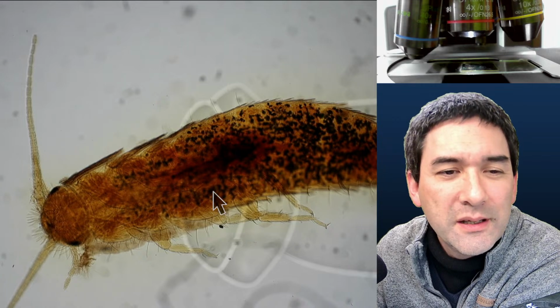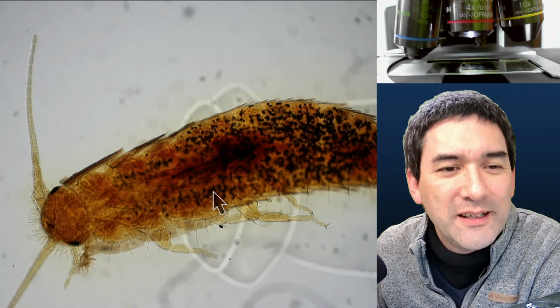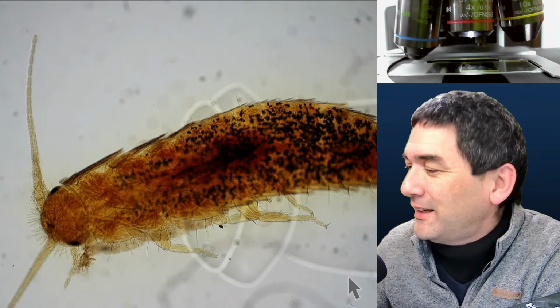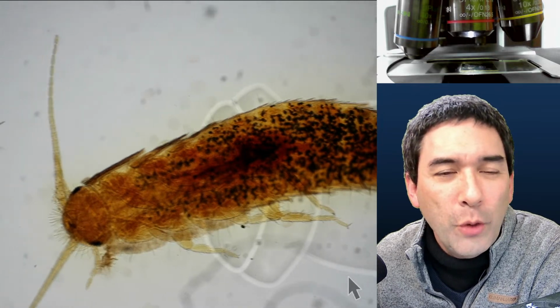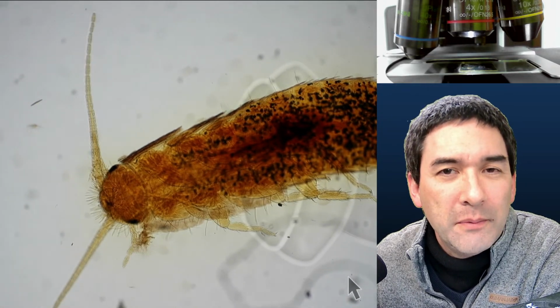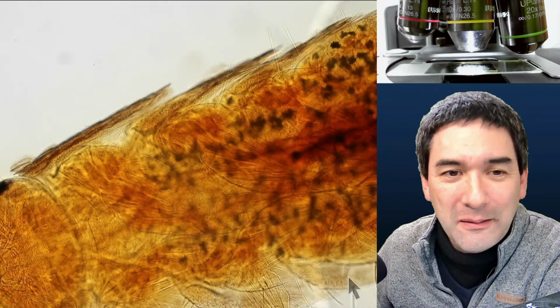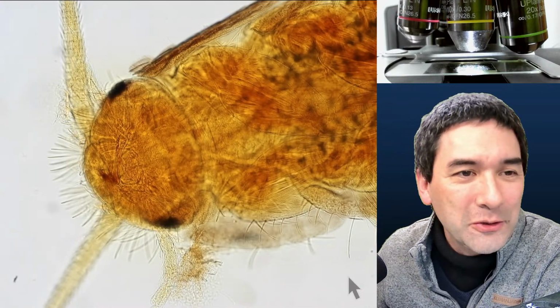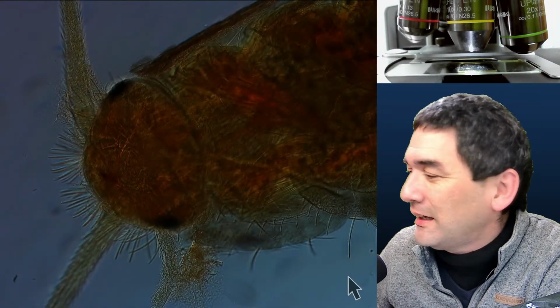It's completely harmless. Okay, it's a silverfish. Yes, exactly. Silverfish are common in many households. As a matter of fact, they keep the place clean because they eat the dust and dirt. And again over here, if you zoom in, let's put this one in again.